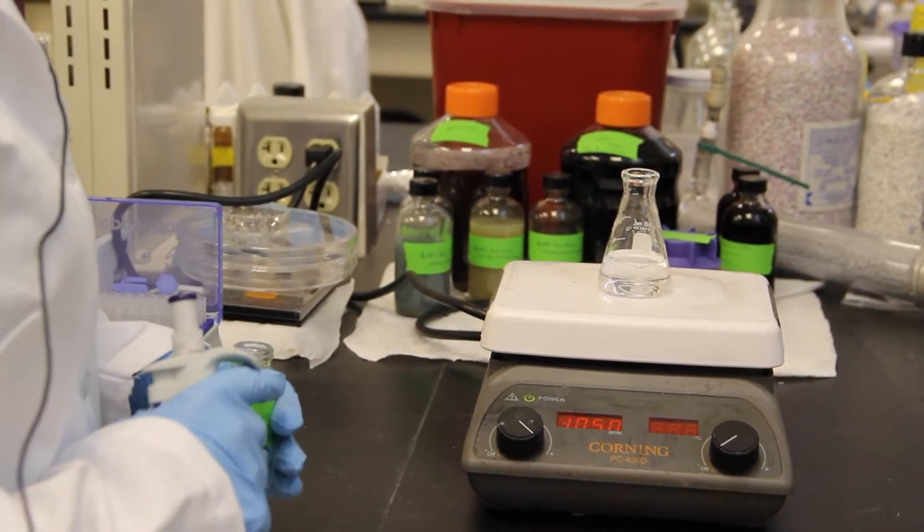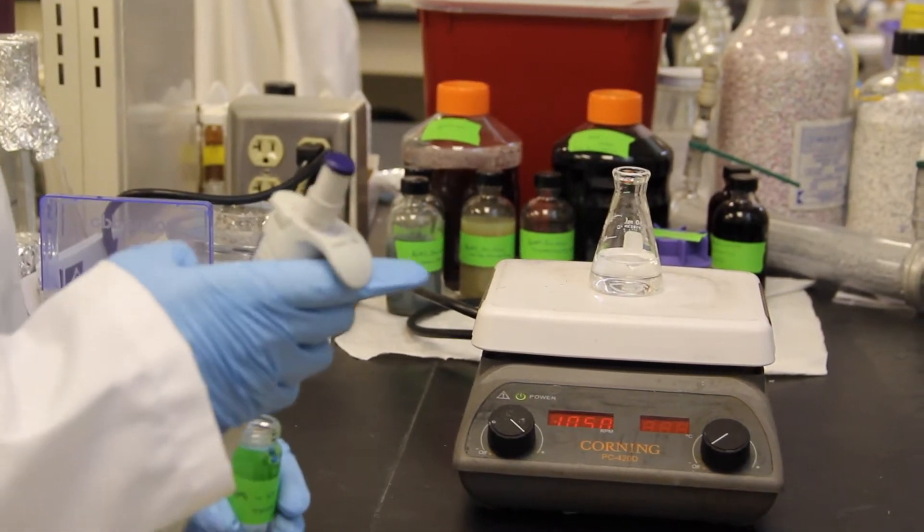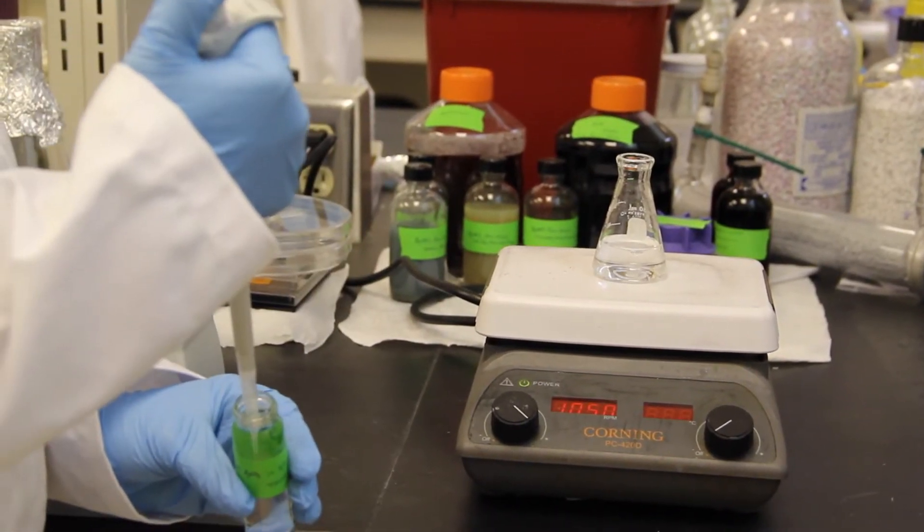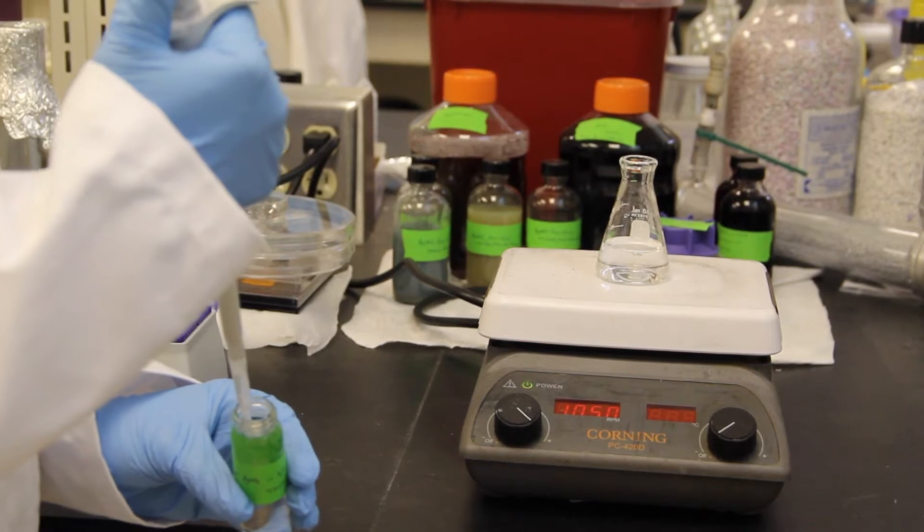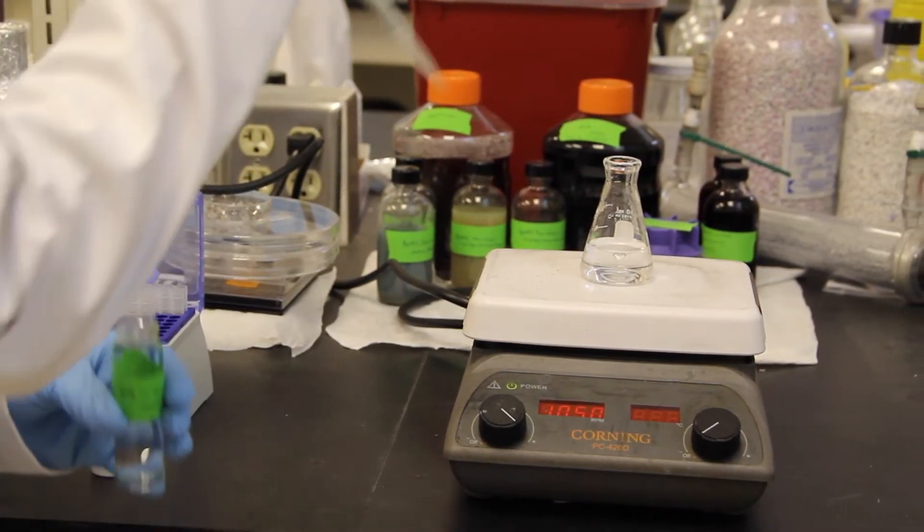So right now we just have water stirring on a stir plate. We're going to add our silver ions.